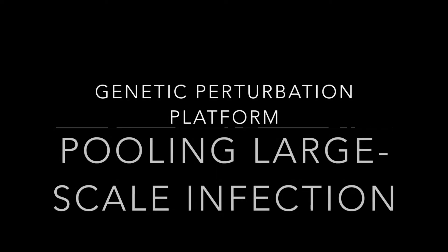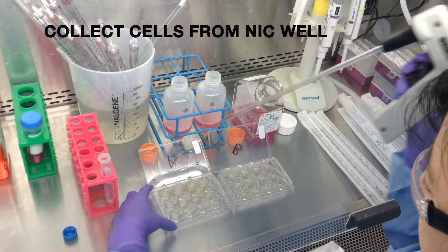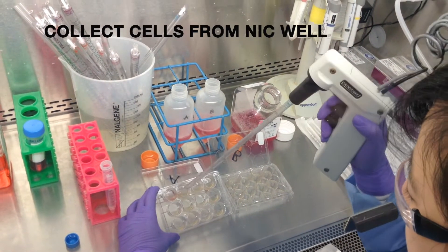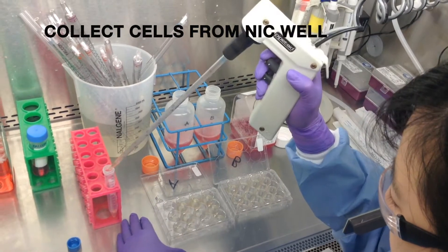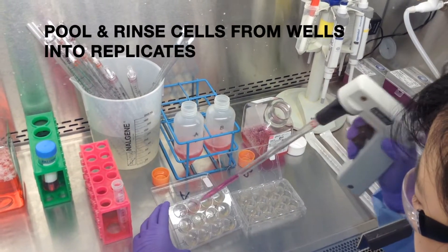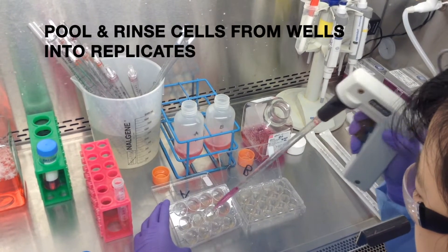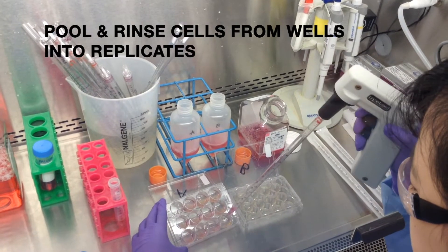Pooling large-scale infection. Collect the cells from the NIC into a conical. Collect the cells from the wells and pool into replicates in separate conicals.